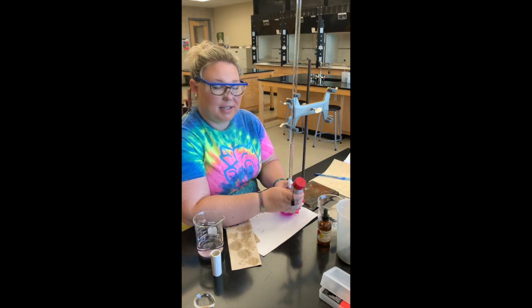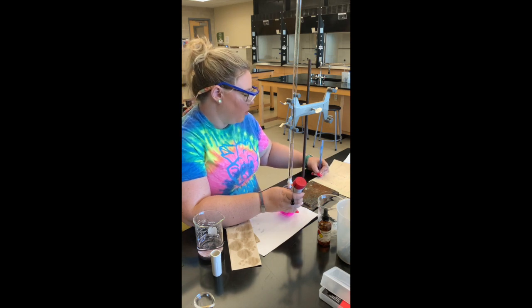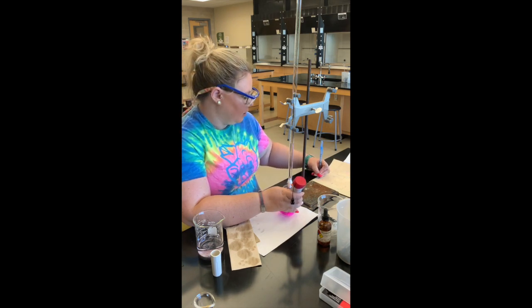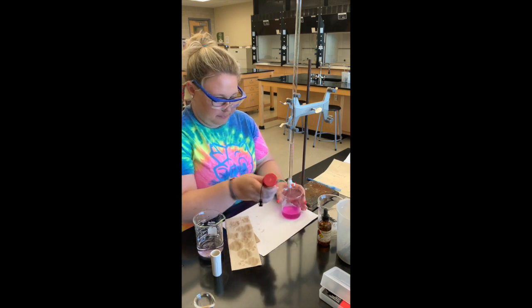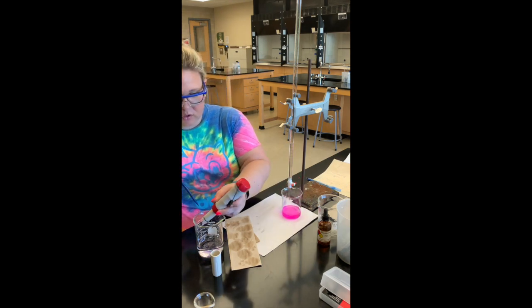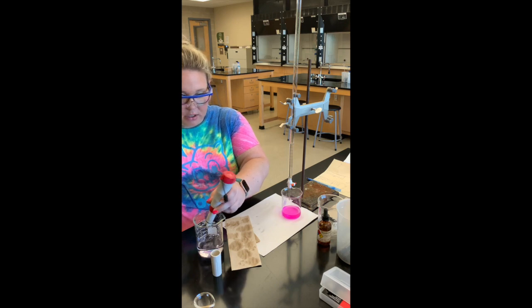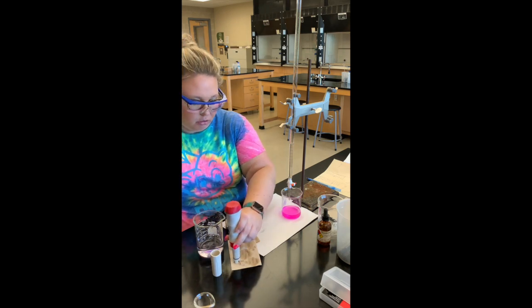Our solution is staying pink. The pH jumped a significant amount — it went from 6.1 to 9.8. I'm going to go a few more milliliters so that you get a good graph.